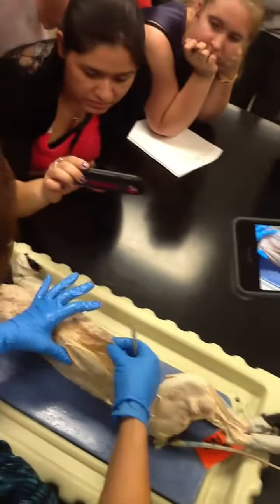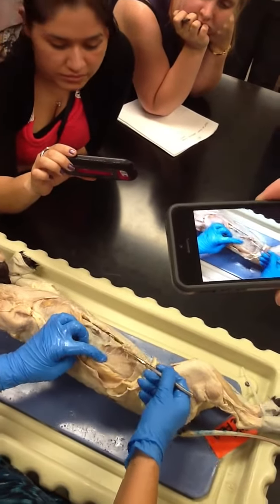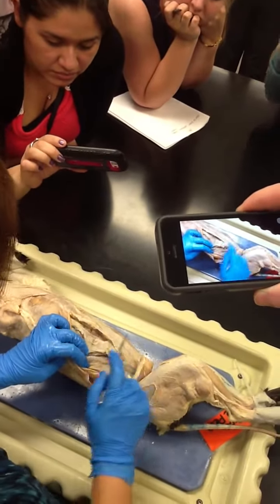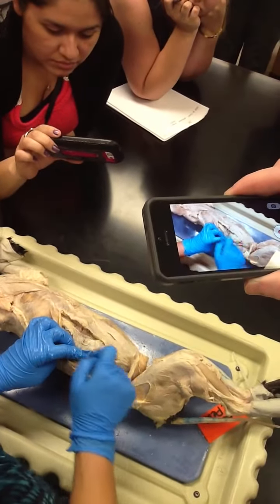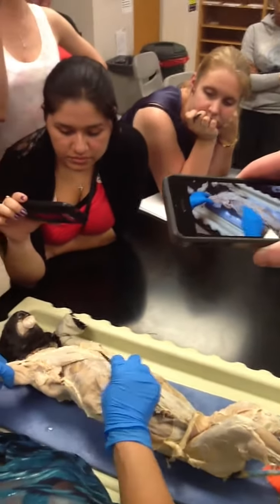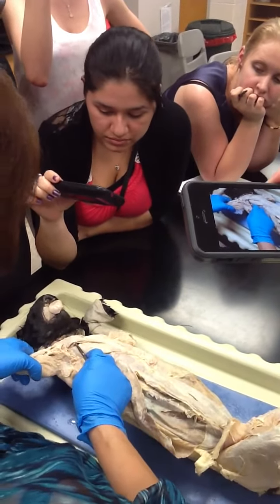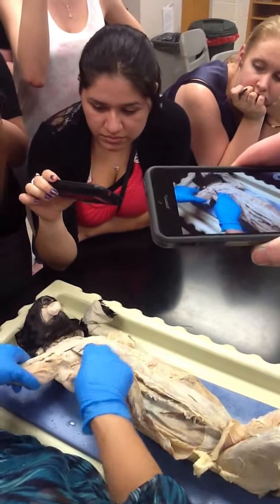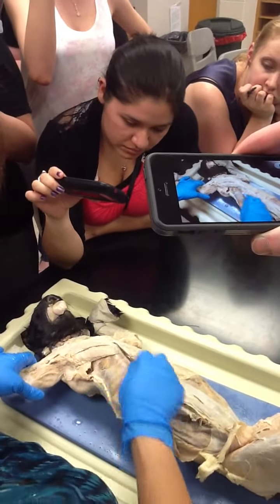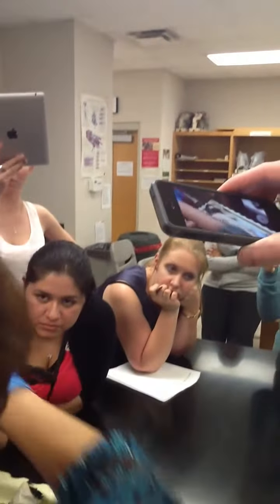Looking at the stomach, you have the external oblique, pull it back. Right here will be the internal oblique. Right here is the transverse abdominis, and then the rectus abdominis. Coming up, we have the xiphohumeralis, the pec minor, the pec major, and then pectoantebrachialis. All of that, the sternum, is the origin.